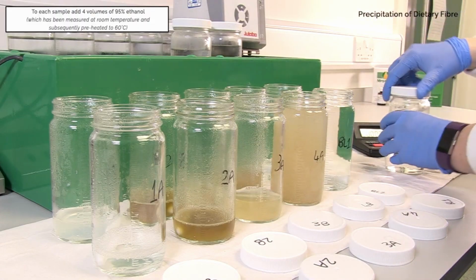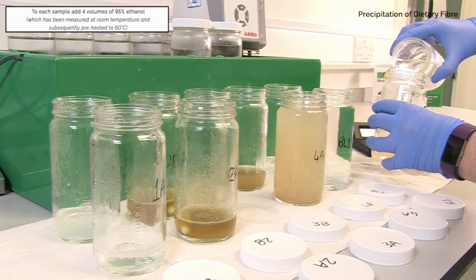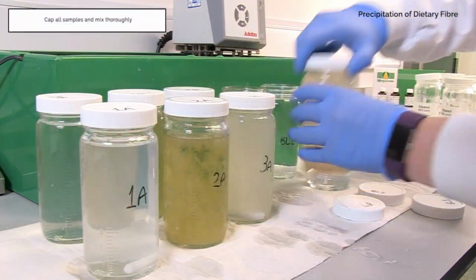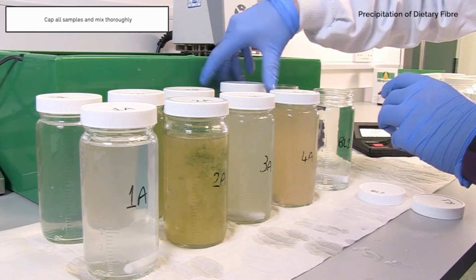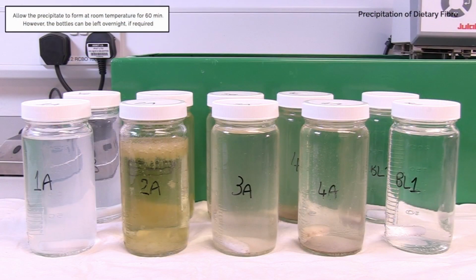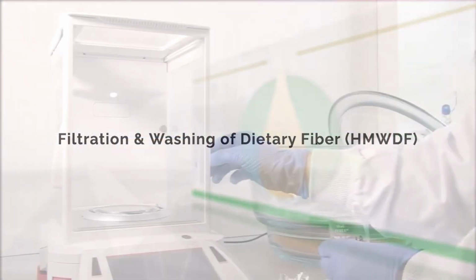To each sample, add 4 volumes of 95% ethanol, which has been measured at room temperature and subsequently preheated to 60 degrees Celsius. Cap all samples and mix thoroughly. Allow the precipitate to form at room temperature over 60 minutes. However, if required from a time standpoint, it can be left to sit overnight.